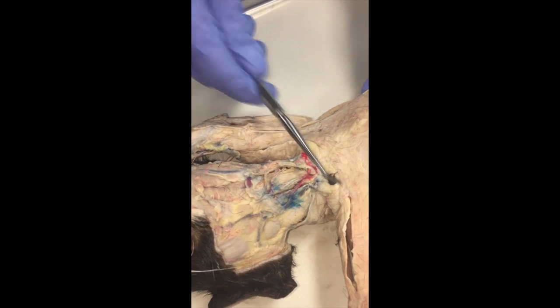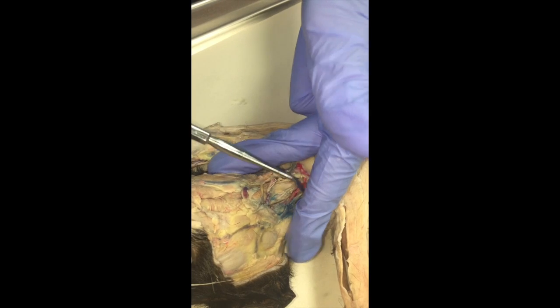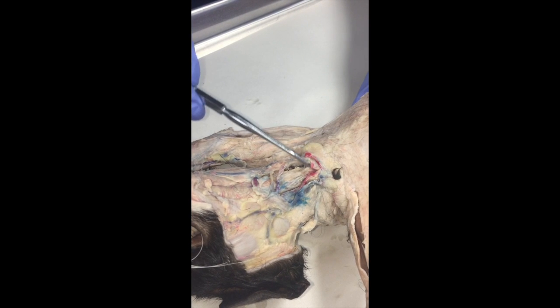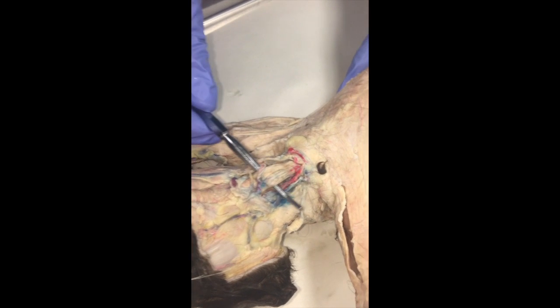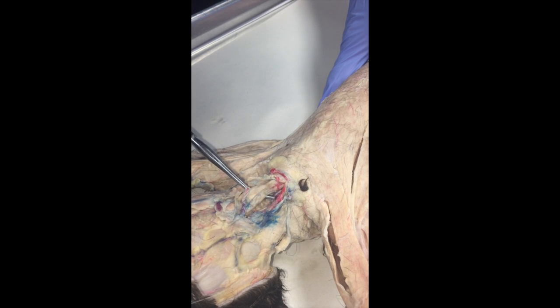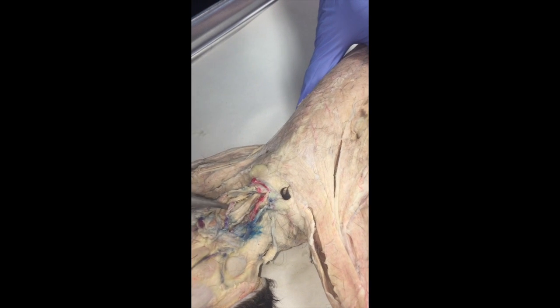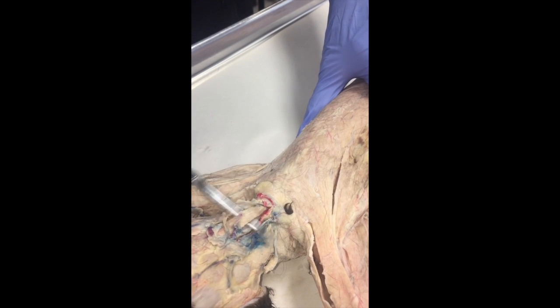Coming down to the sternum, we have a bunch of muscles that start with sterno. This first one is called sternomastoid, and it makes this V-shape here, going up to the mastoid process. Then, also originating from the sternum, is this pair of straps that goes right on top of the trachea — this is the sternohyoid muscle. It ends on the hyoid bone and there are two of them, parallel to one another. Right underneath and lateral to them is the sternothyroid, which is lateral to and deep to the sternohyoid.